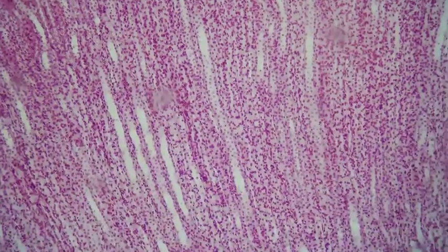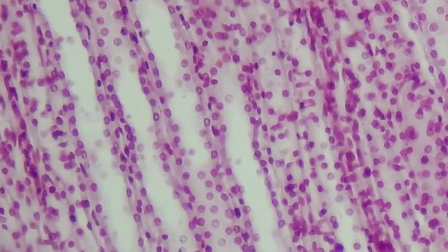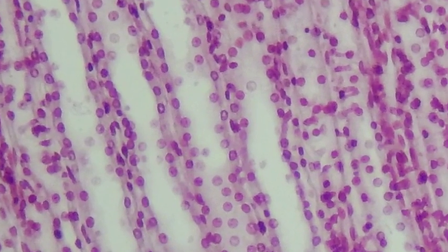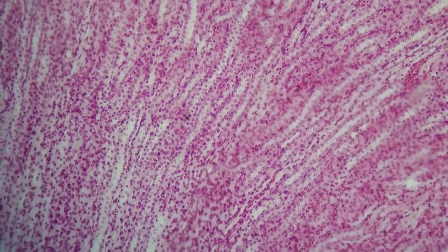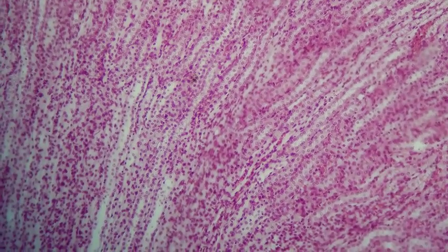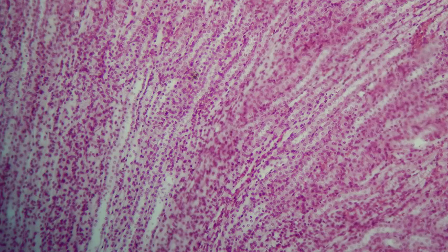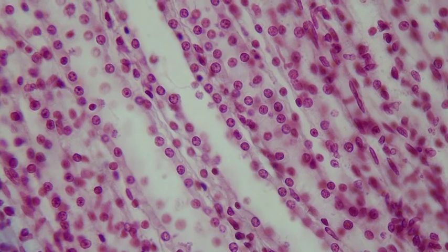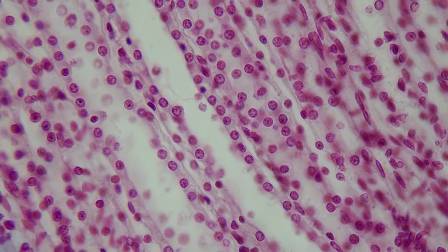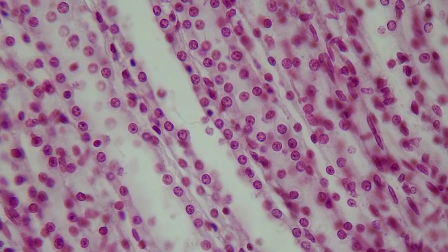but also the very long loops of Henle of the juxtamedullary nephrons. These are the nephrons whose long loops of Henle dip into the medulla of the kidney, as opposed to the cortical nephrons, whose shorter loops of Henle stay primarily in the renal cortex. These long loops of Henle can be identified in a microscopic view of the kidney.